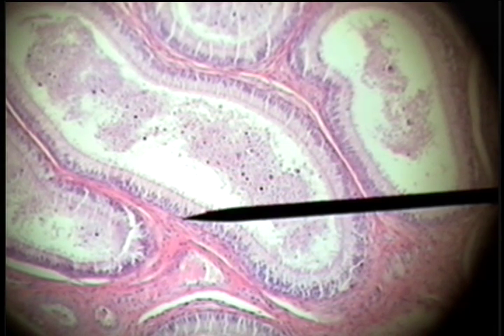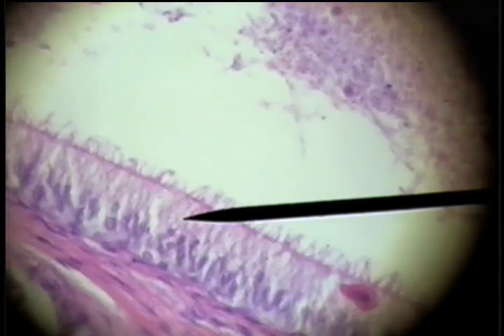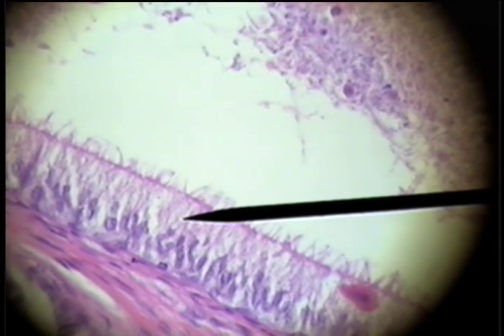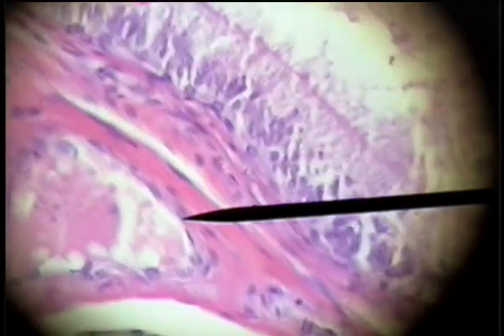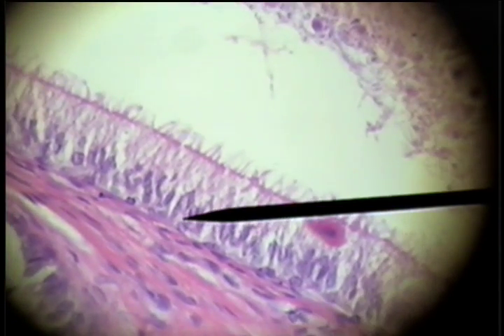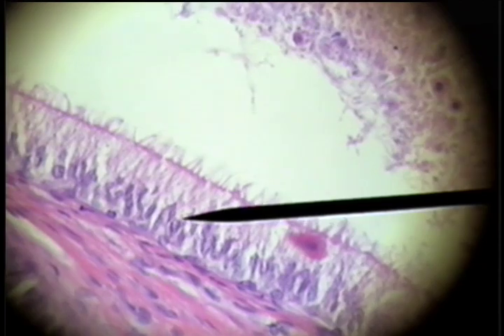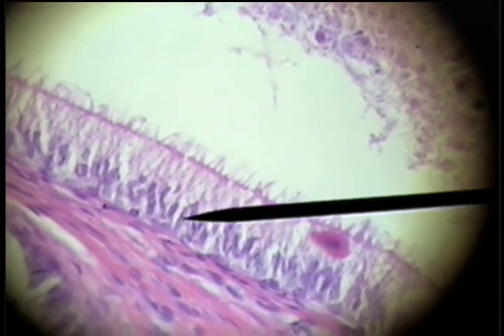Looking at this epithelium on higher power, we can see the basement membrane here, and then the layered nuclei that give the appearance that the cells are stacked on each other.